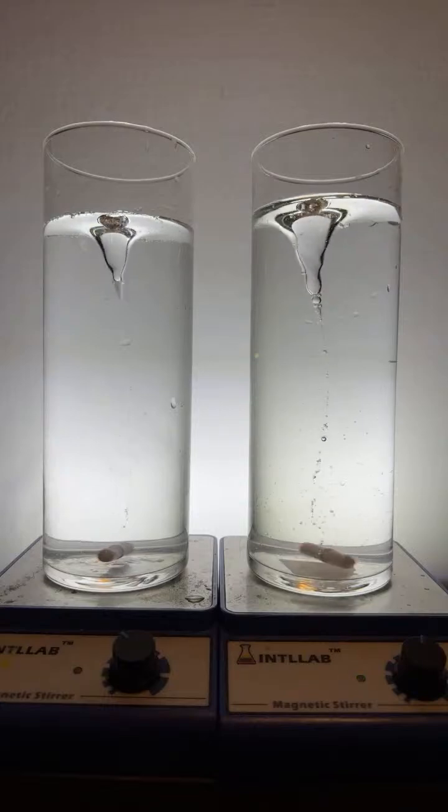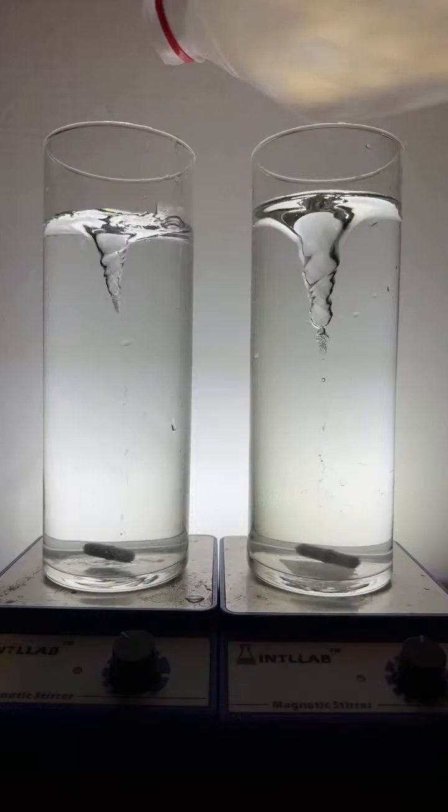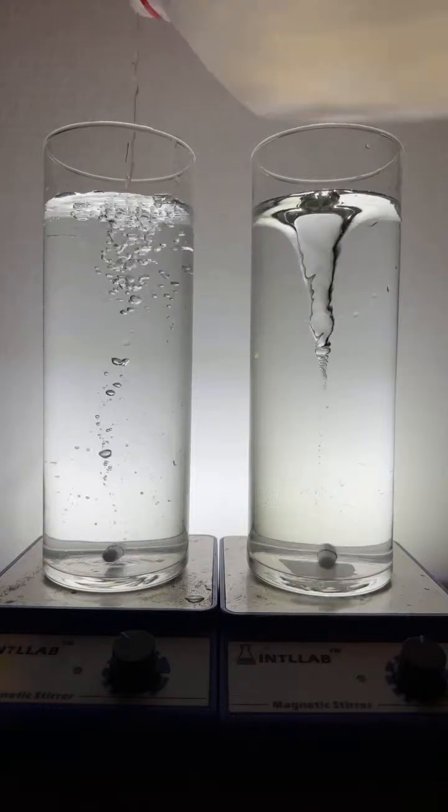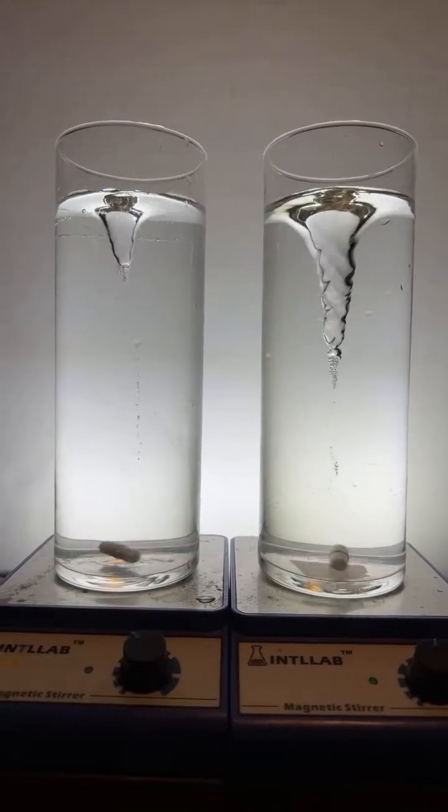Oh, that looks nice. Get a little bit more water over here on this side. There we go.